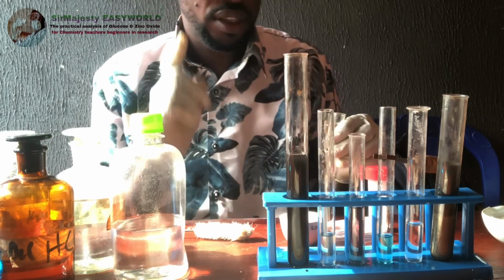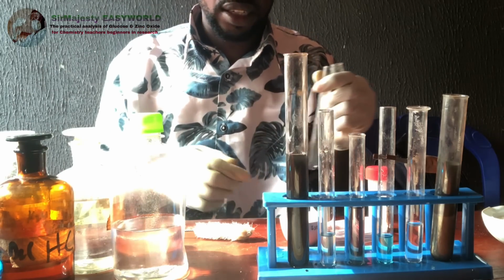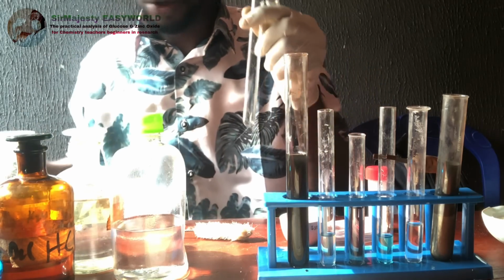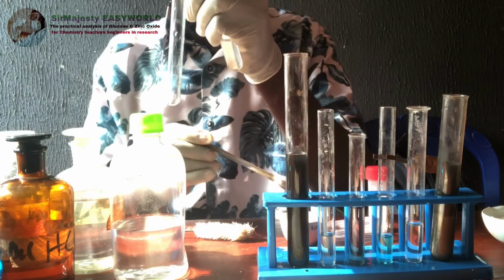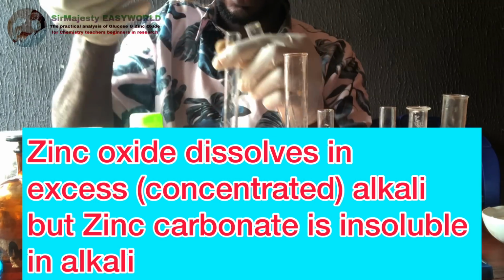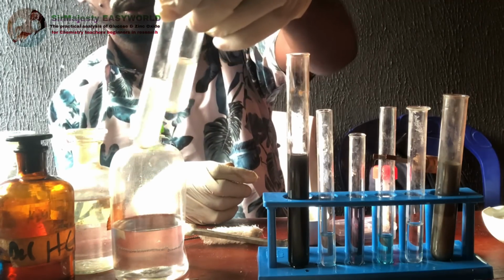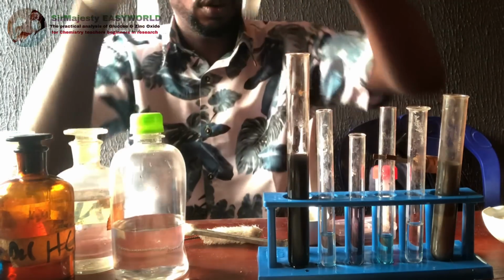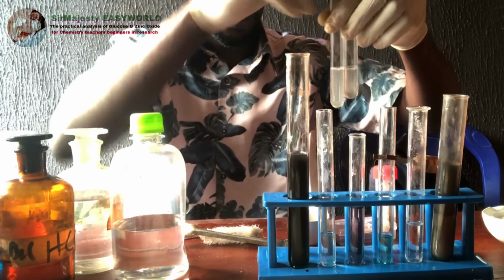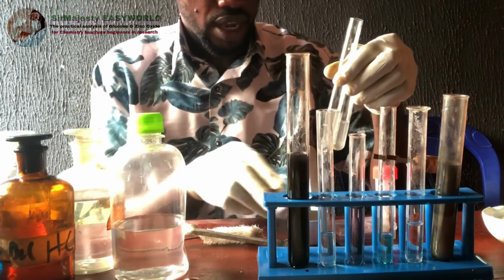Okay, so having seen the solubility of zinc oxide in acid, let us check the solubility in base. Being amphoteric, it will dissolve both in acid and base. I will now add, this is the zinc, so I think you see these two, but the carbonate will not dissolve in a base. So most of you will buy the carbonate instead of the oxide. So, well, this is the reality.